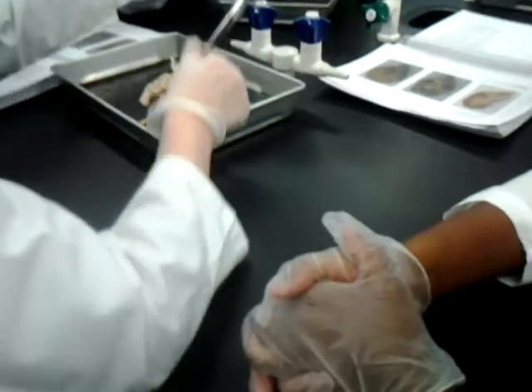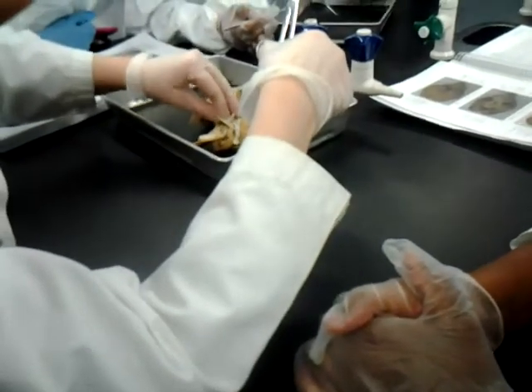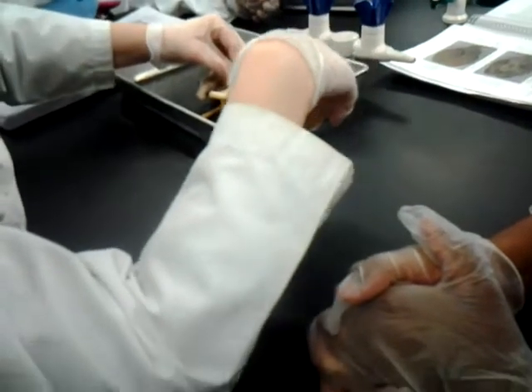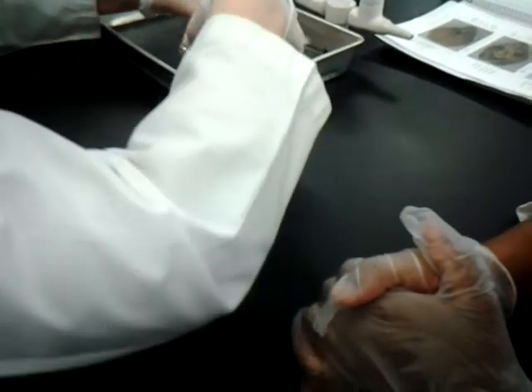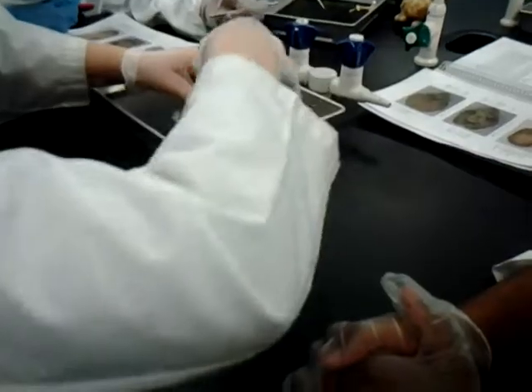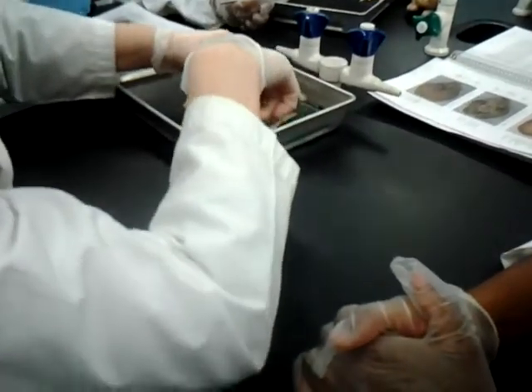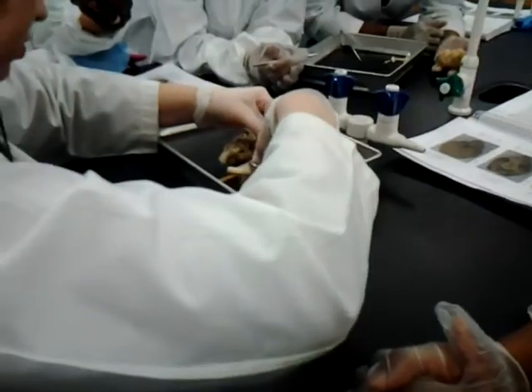Let me see what yours looks like. Okay. Alright, fortunately, you still have part of the trigeminal. This one we don't need. Oh, there's the other part of the trigeminal. Let me try to keep that. So you see what I mean? You cut at the top, and you might actually keep some of it on. So we kept our trigeminal on the other side. The middle thing I don't need.